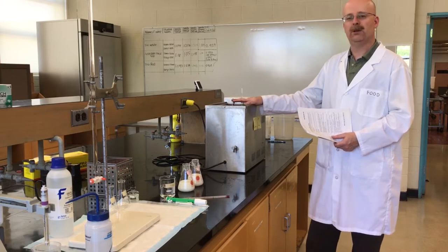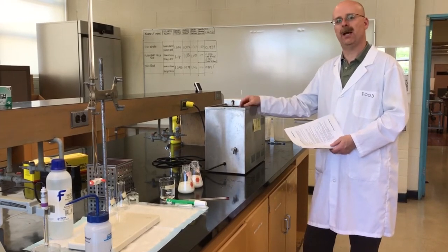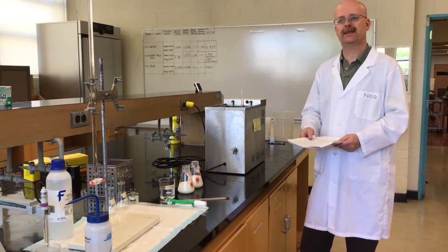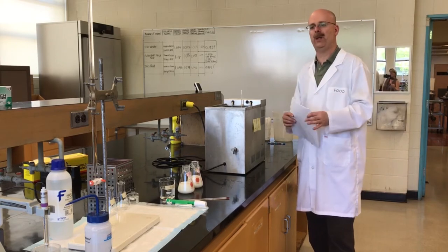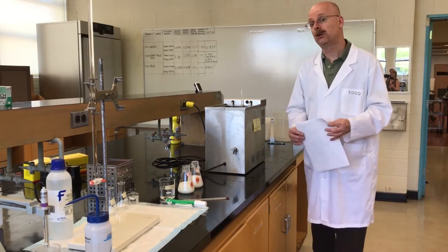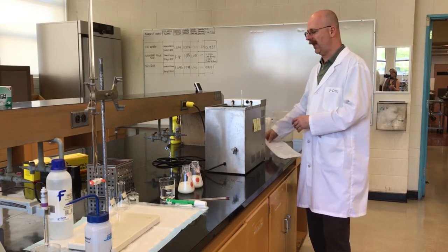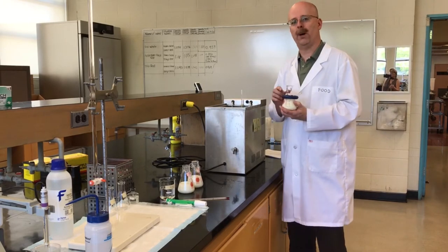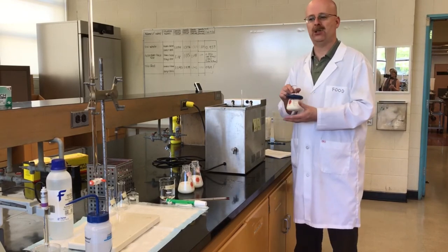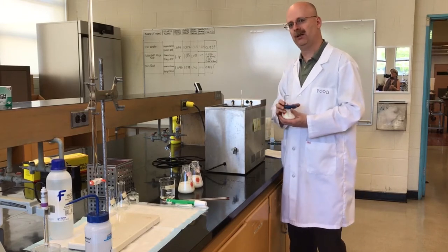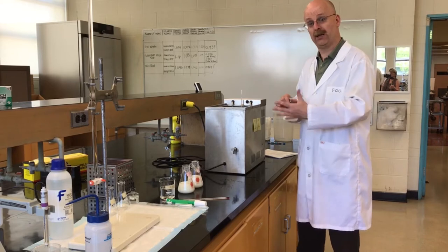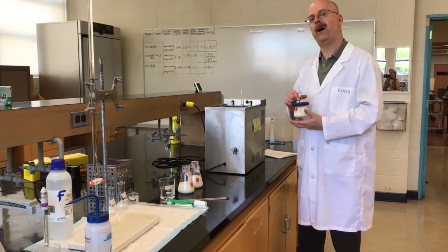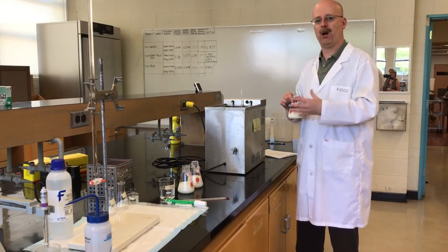In addition, we're going to be doing a few simple tests, usually done by the lab personnel at your place of manufacturing. One of the quick tests is basically to gauge the quality of the milk coming into the plant. In order to look at aroma, we would want to have to warm up the milk. Here we're using, for the purposes of the demonstration, pasteurized milk. Unfortunately, I don't have access to raw milk here at BCIT; it's not commercially sold as you're well aware of. So the aroma profile is slightly different on pasteurized milk than it is on raw milk.